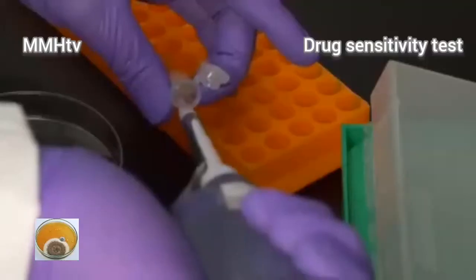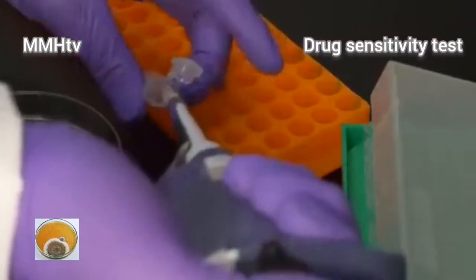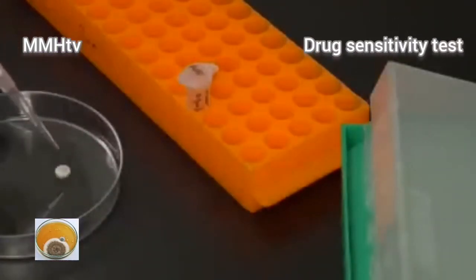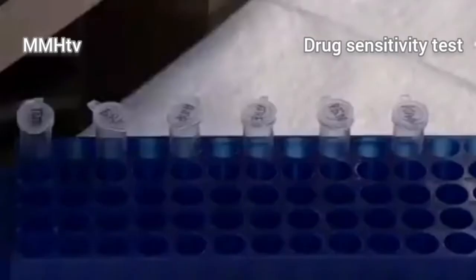So what do you need to do drug sensitivity tests? You will need discs that have been soaked in specific plant extracts of interest. This is done in a sterile environment. These discs are stored in vials. Like here, we have 6 vials with the discs from different plants of interest.